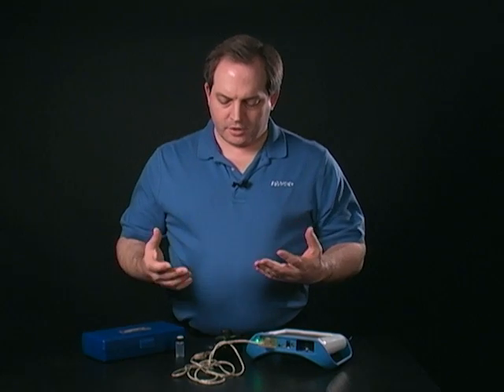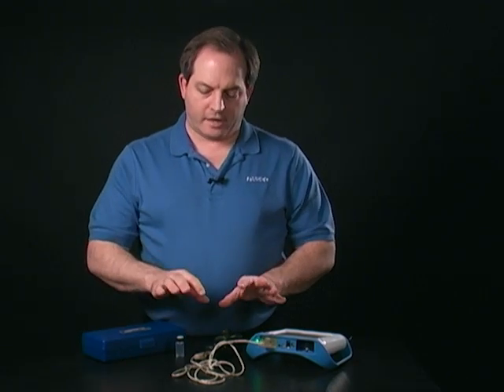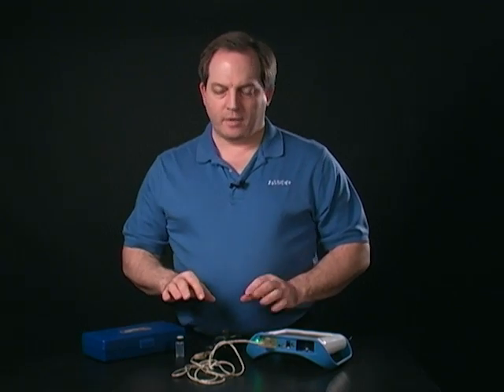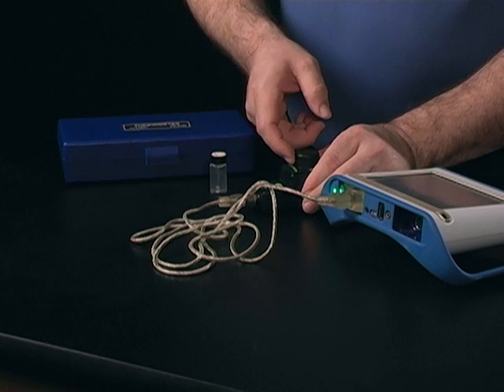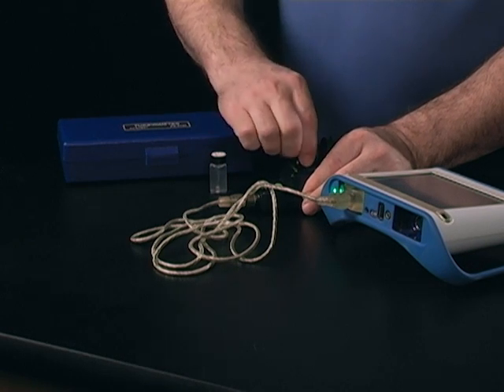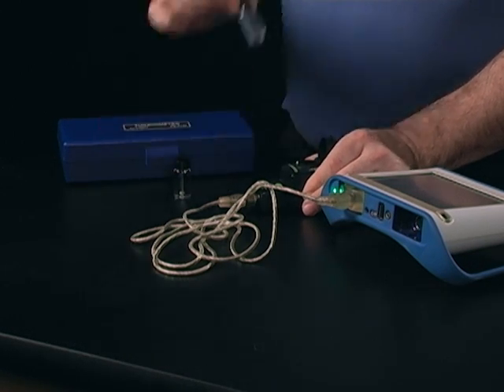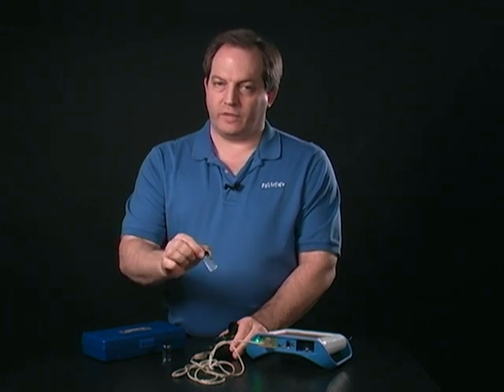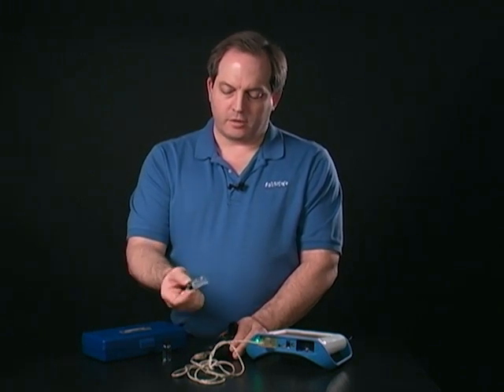What it's going to do is start the calibration process. A little light comes on the button, and then once that light starts blinking, you're going to take that sample out and replace it with the 100 NTU sample that comes with the turbidity sensor.